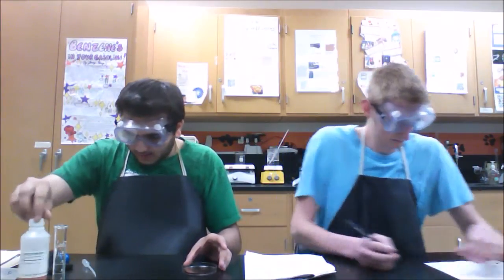So right now the petri dish has the potassium thiocyanate and the 3 drops of iron 3 nitrate sitting there. Then it asks us to swirl it. So you put the lid back on and swirl your solution till there's a color evenly throughout. Now, that's about a lightish orange.